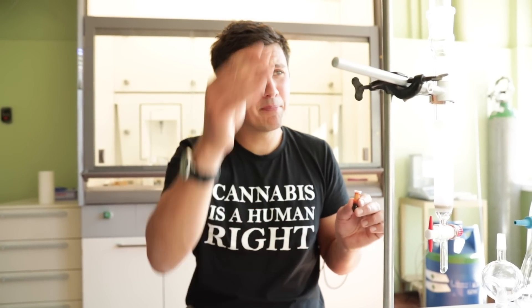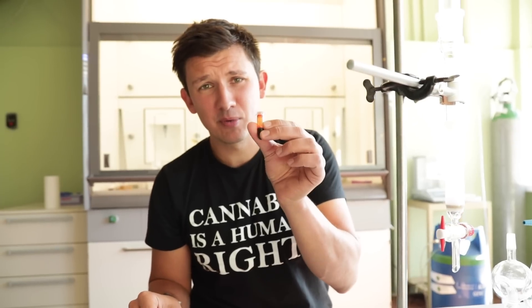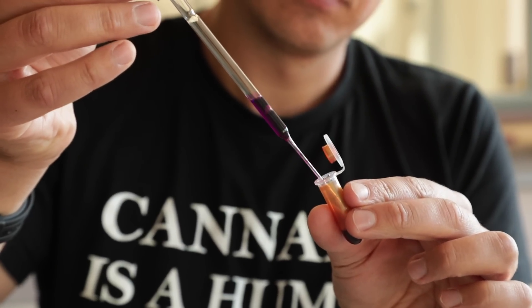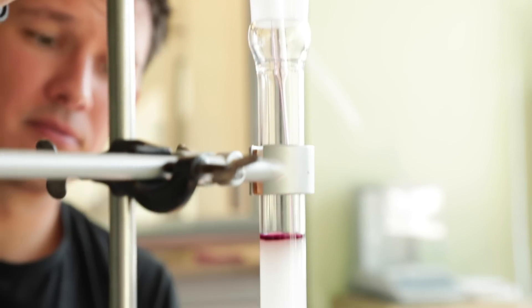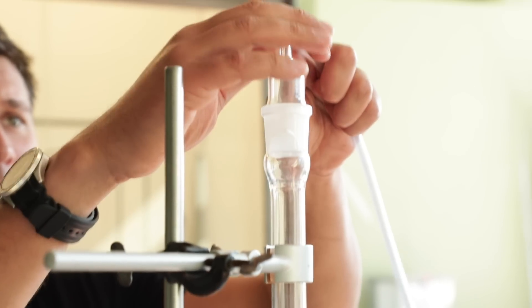I'm going to show you how it works with color. When you put the extract through, it's not so colorful — you're not going to see that much. So I'm going to put some color inside so you can better see how it travels through the column. Now we take the color and apply it in our chromatography machine. Put the lid on, apply the pressure.